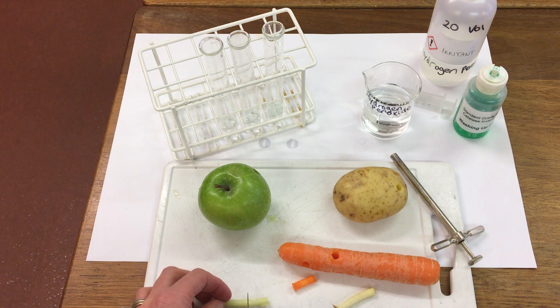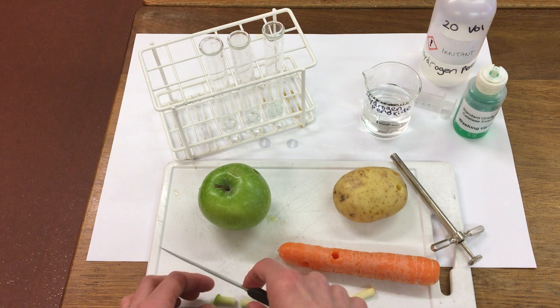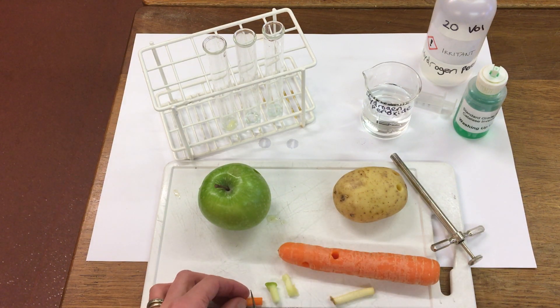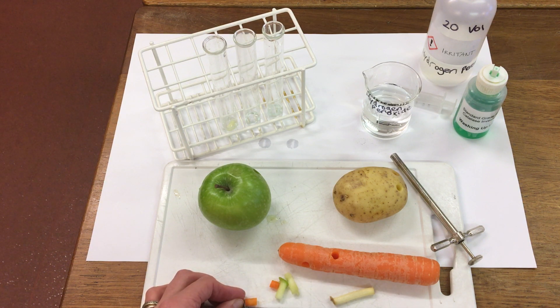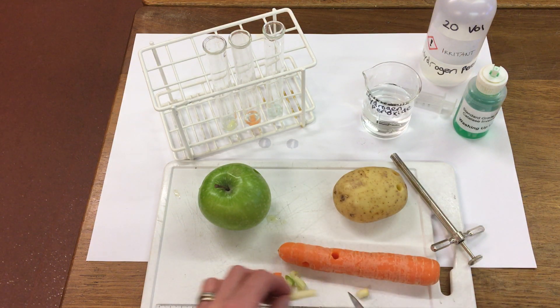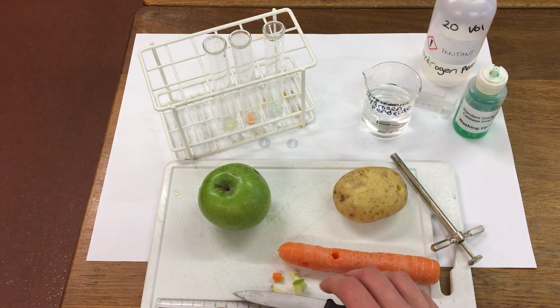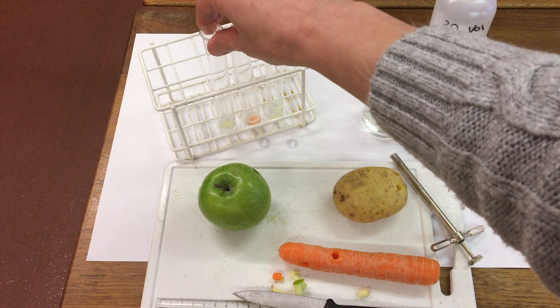So apple - I'm going to put that piece into our first test tube. And then carrot. And then potato. And then gently mix our test tubes.